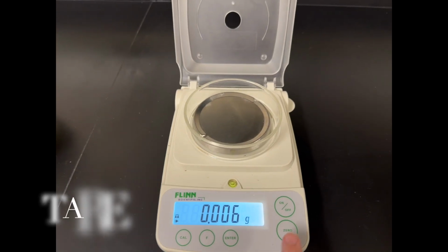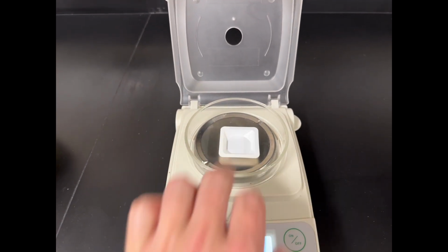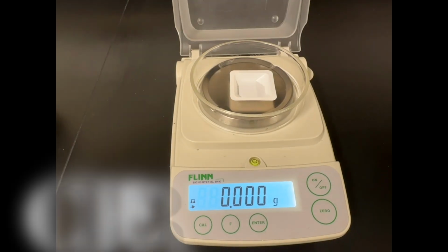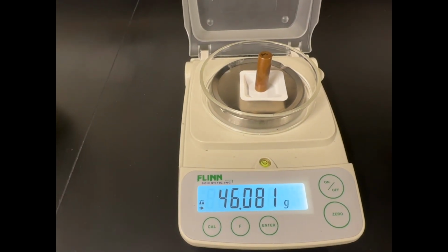We're going to use 4 different cylinders. There's a copper, a brass, a glass, and an aluminum cylinder. The first thing that we'll do is take our scale. We're going to add a weigh boat to it so that we don't put anything directly on our scale. Remember to tare it. Then we'll add the first of our cylinders. In this case, it's copper. Make sure to record that in the table.